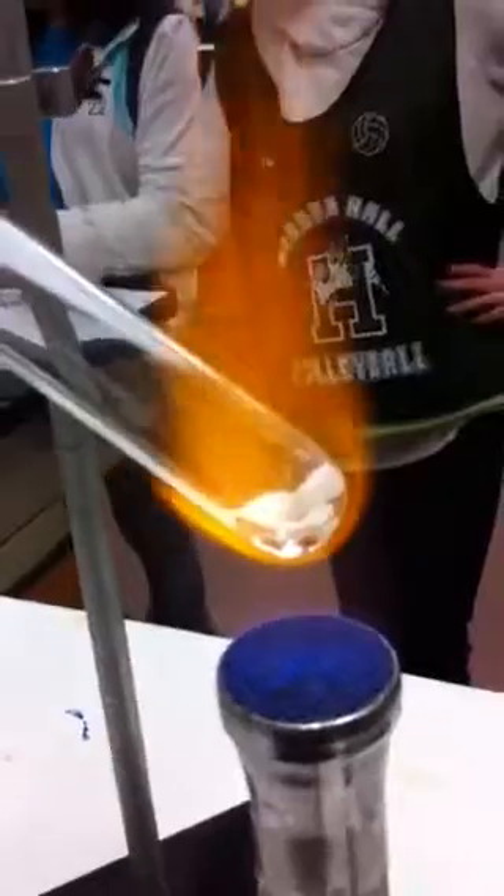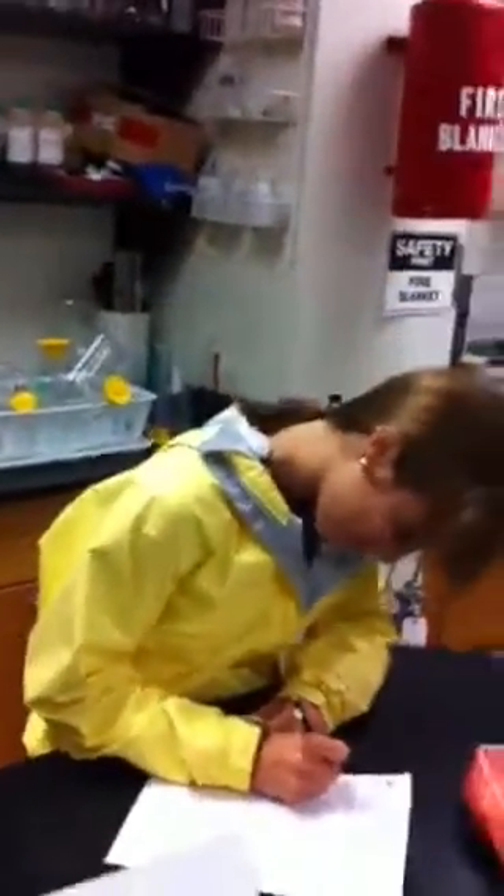I bought it at some shop. How much did it cost? It might get to a thousand degrees. Here are all the happy students doing our salt demo. I don't think you have one that goes up to a thousand degrees like I do — my toy's better than your toy!